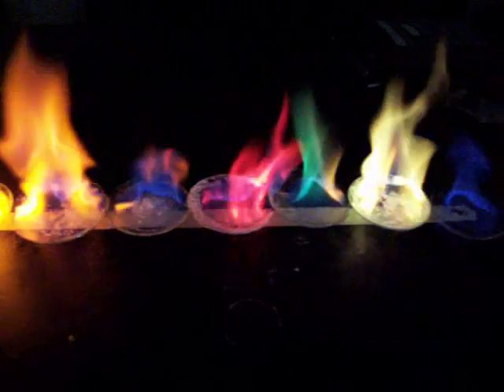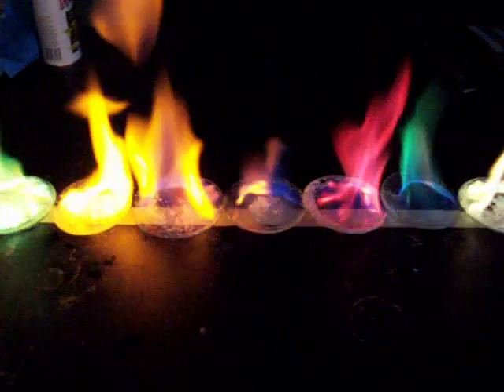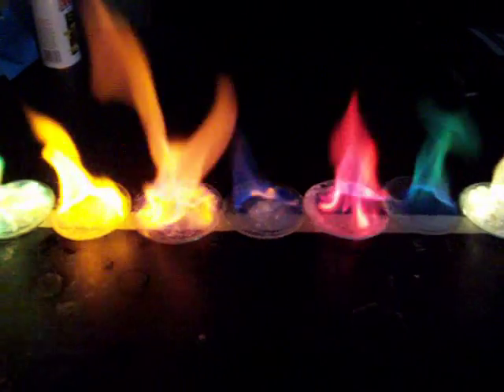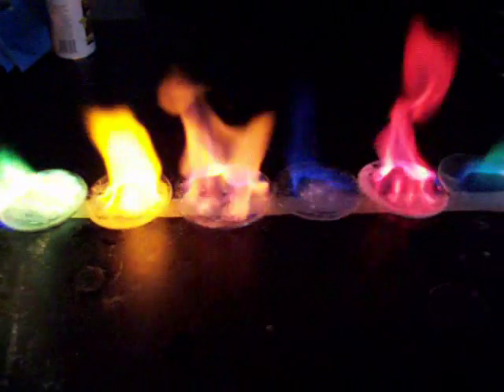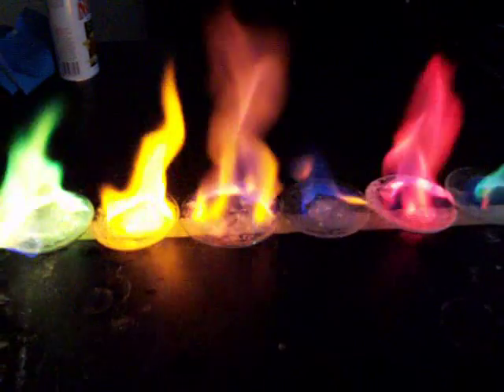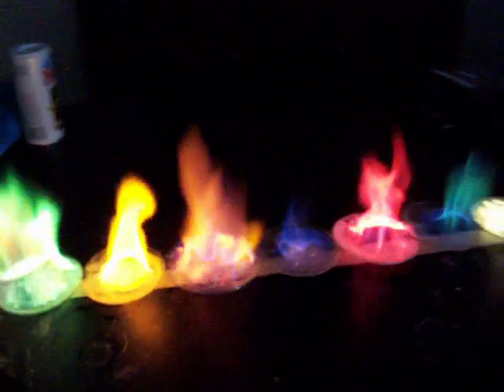Then we have boron being green, strontium giving us the crimson red color. Next is calcium giving us the orange — not showing up very well here — but the red tints inside of that orange. There are some impurities there. That is lithium.